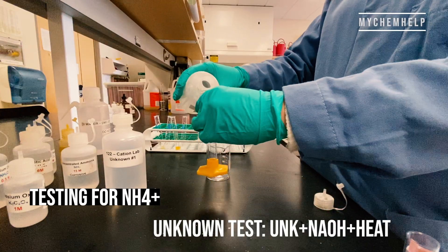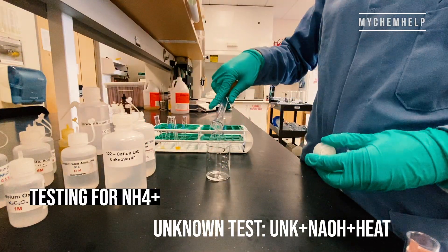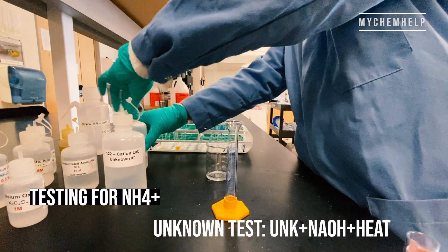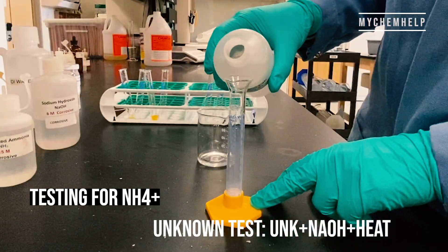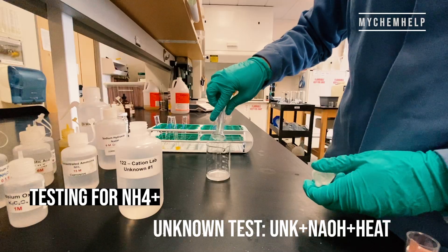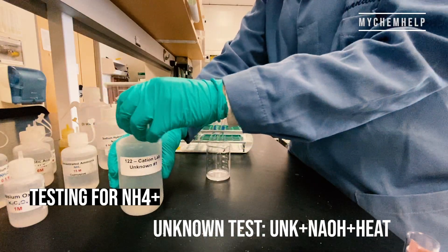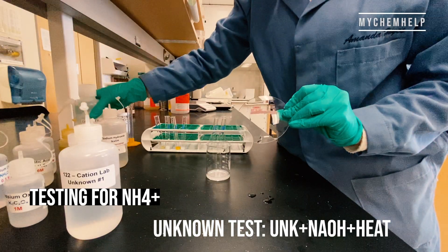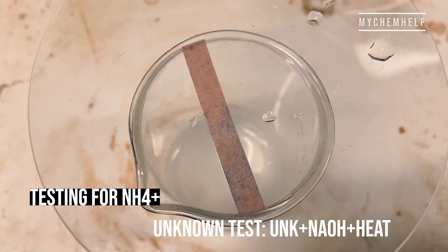So now we're doing the same process with our unknown. I wasn't expecting that to happen. Watch glass, litmus paper. Now let's put that on a hot plate and see what happens. I'm not so sure about this one — what do you guys think is happening?